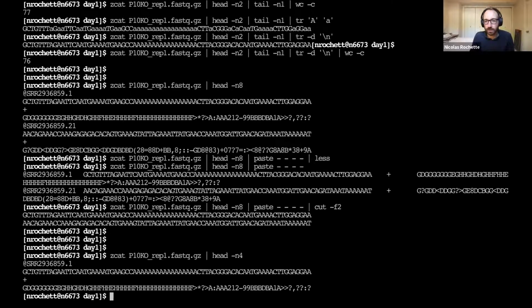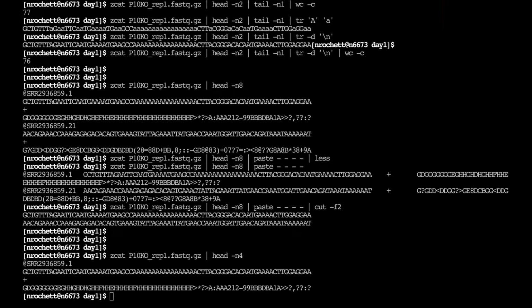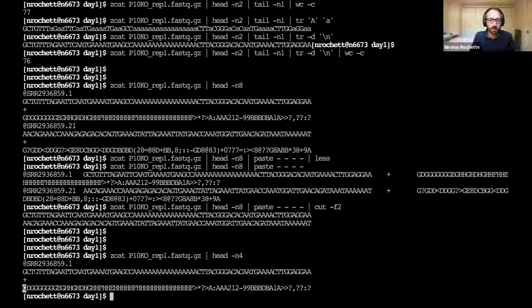Yeah, so right below it, coincidentally, it's also a G. Looks like. So this is also G. And then the G, to understand what the G actually means, you actually have to go back to the ASCII table. So you can go back to the PowerPoint.